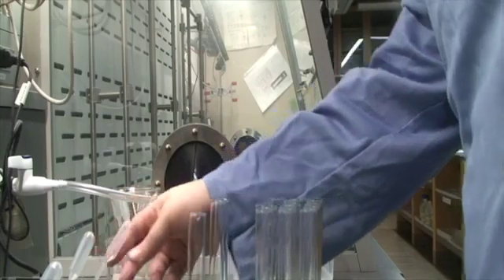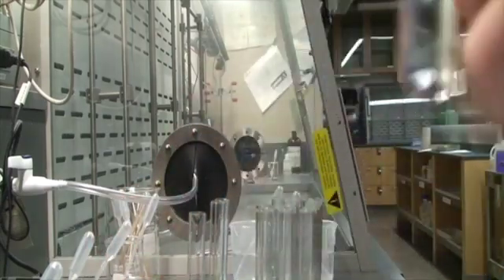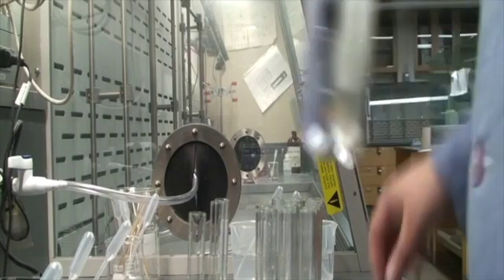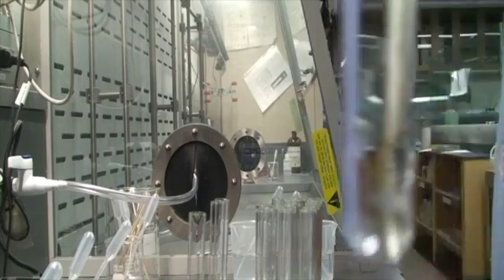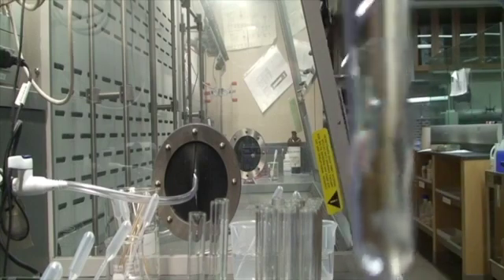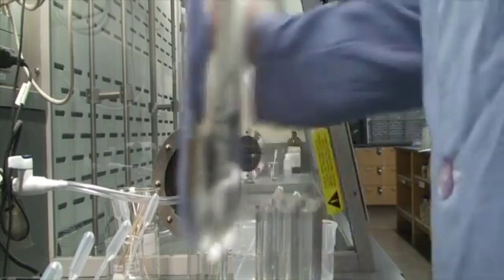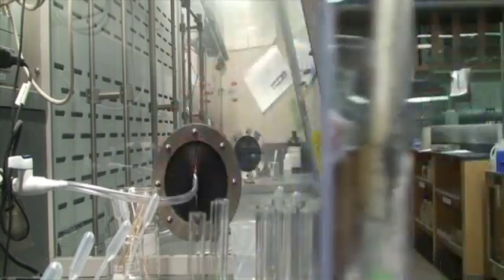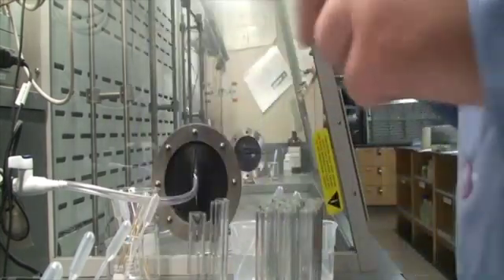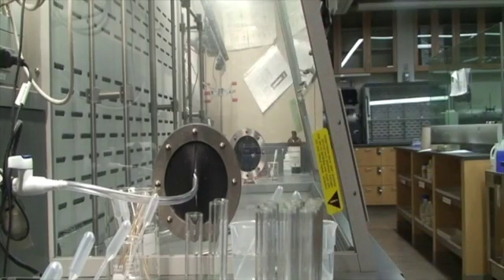Okay, I'm not seeing a precipitate there. See, that's still clear. It does not feel warm. No bubbling. Let's do our smell test. No smell. Okay, 11 and 13 is finished, and last but not least, 12 and 13.